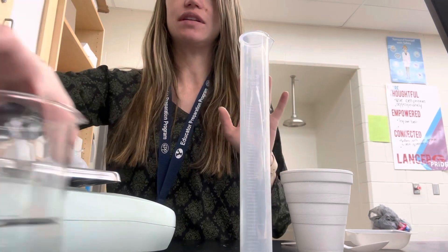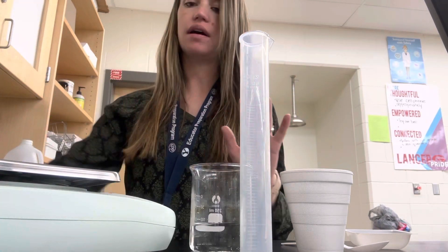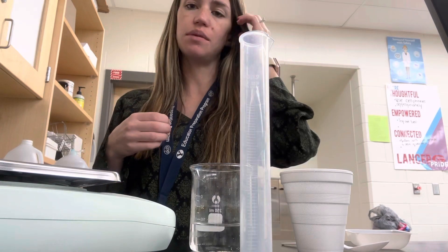I've set out lots of the different things that you'll need for this lab. Out front here I'll show you how you're going to use them and what steps you're going to do.